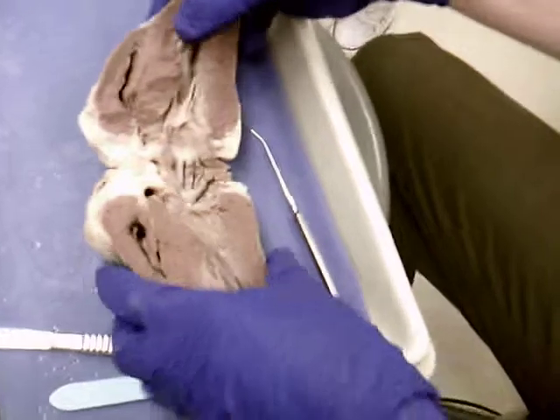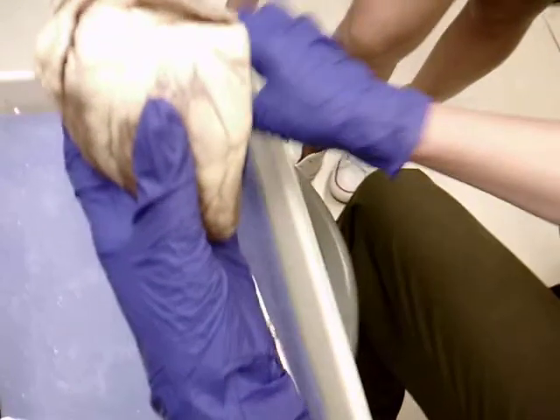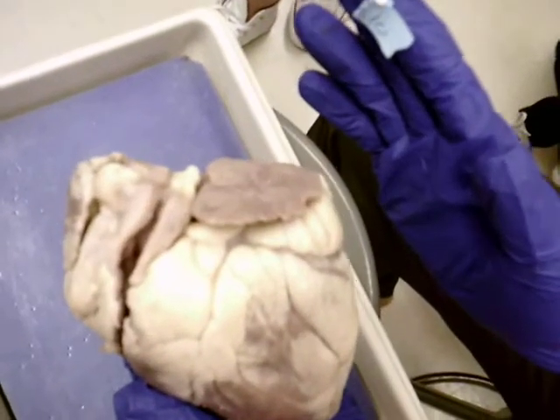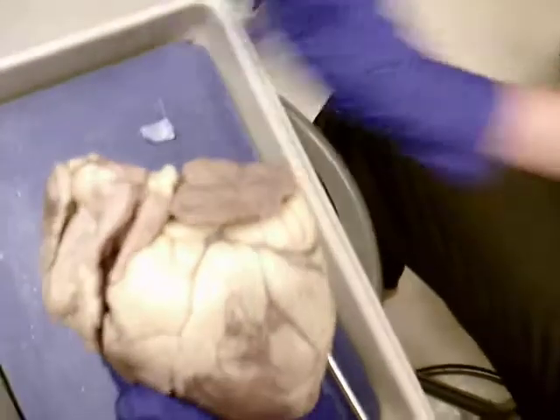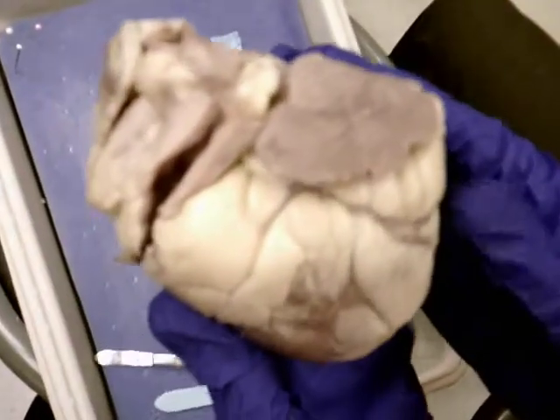Alright, so we have the heart. Again, we'll do this many times when we come back. It's okay, right? I'm gonna get a good one. We have the heart, and already we can see these flap-like structures are called the auricles. Right? They're associated with which chambers?